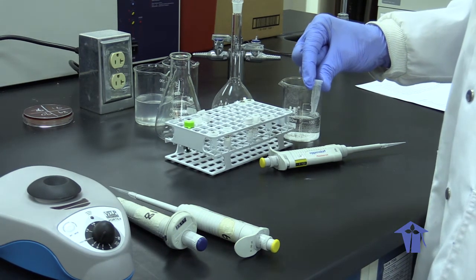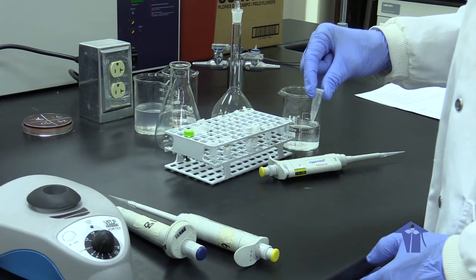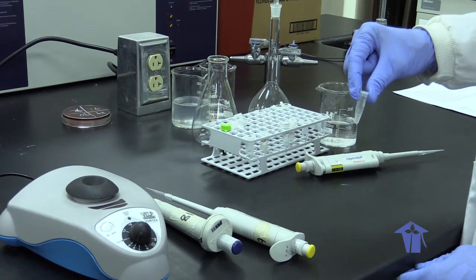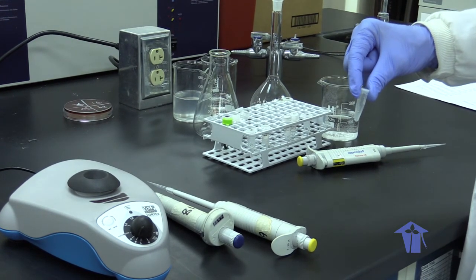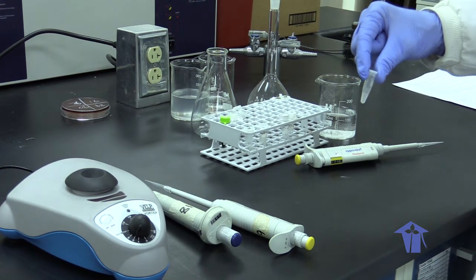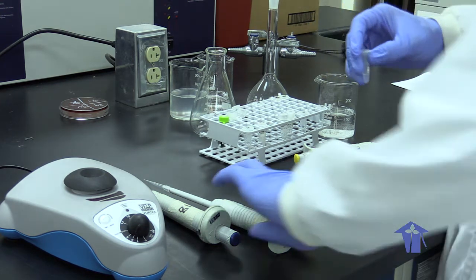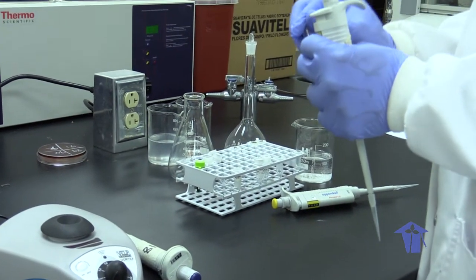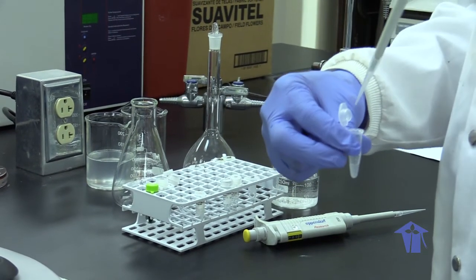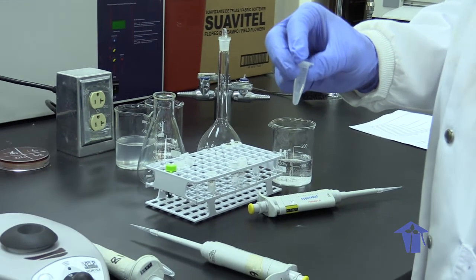After we have taken out our mixture from the water bath at 37 degrees Celsius for 30 minutes, we add 15 microliters of our proteinase K, vortex, and incubate for 2 hours at 65 degrees Celsius. The reason why we add proteinase K is to aid in further digestion of the cell wall. We do this at 65 degrees Celsius because 65 degrees Celsius is the optimum temperature for the operation of this particular enzyme. We will now incubate at 65 degrees Celsius for 2 hours.